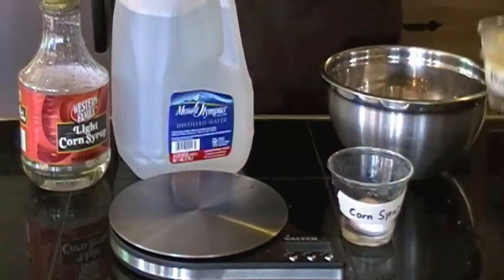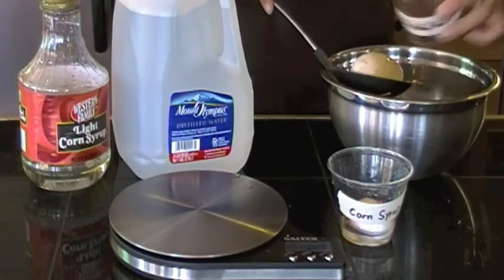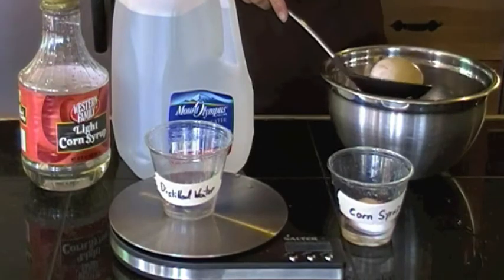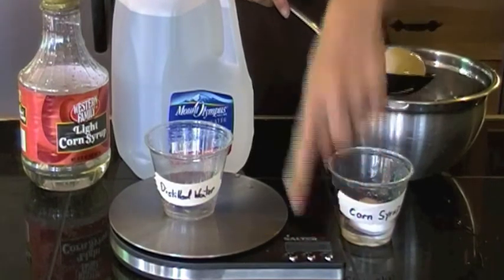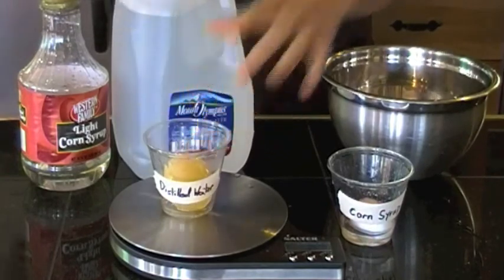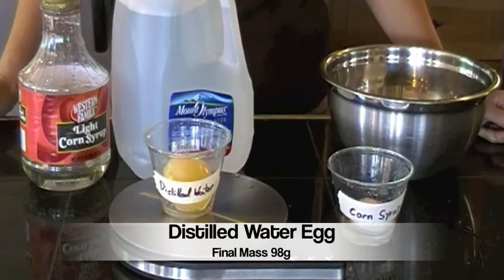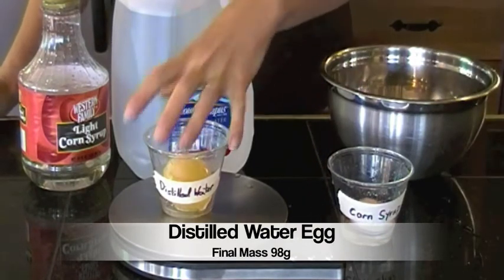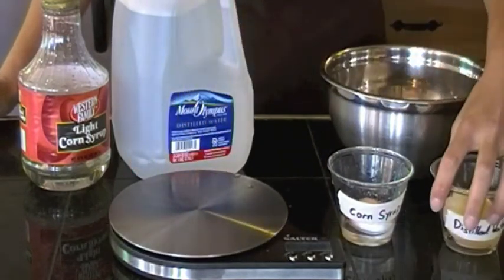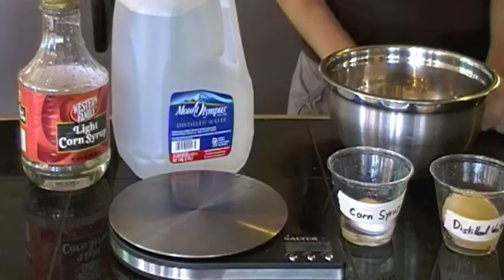I'm going to do the same exact procedure with the distilled water egg. I just remove the liquid, place the container on the scale, tare or zero the container, and return the egg to that container. In this case, we have a mass of 98 grams. That is quite a bit more than it was initially. That concludes our lab. Be sure to record your data and observations and move on to your analysis.